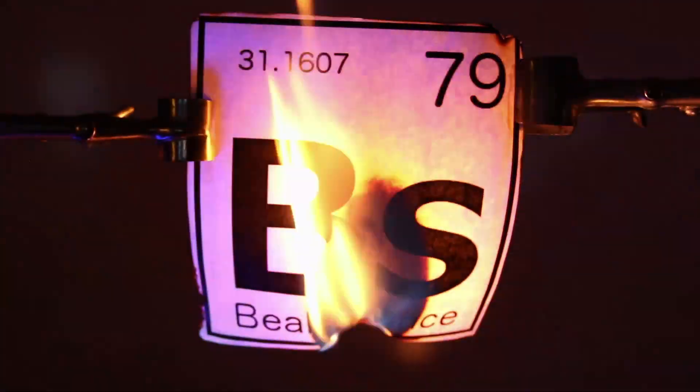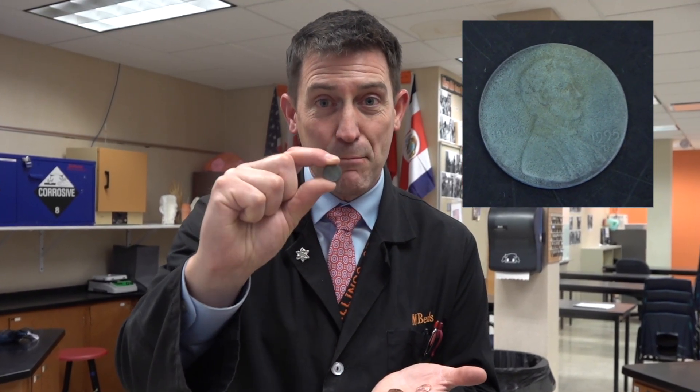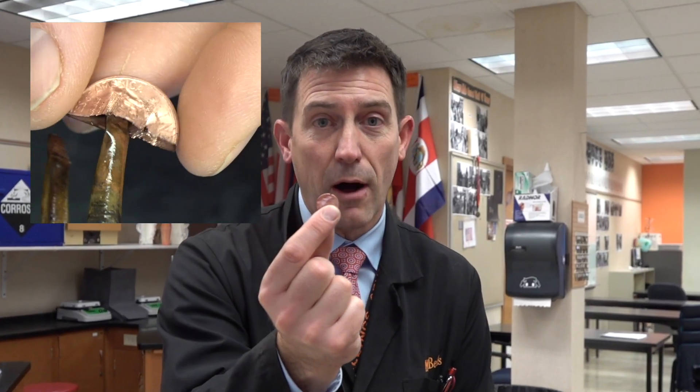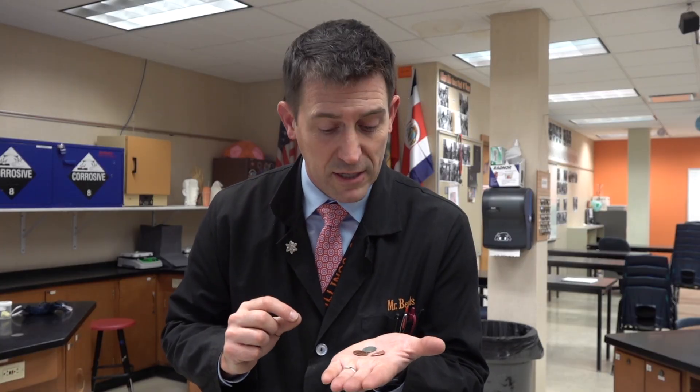Hello! Welcome to Beals Science. I'm Craig Beals and today we're going to do some experimenting with pennies. I'm going to show you how to make naked pennies - pennies that have lost their outside copper shell. You might not even have known they had a copper shell. And also hollow pennies, so hollow pennies that don't have the guts inside of them anymore. And all it takes is some simple chemistry with some simple reactions.